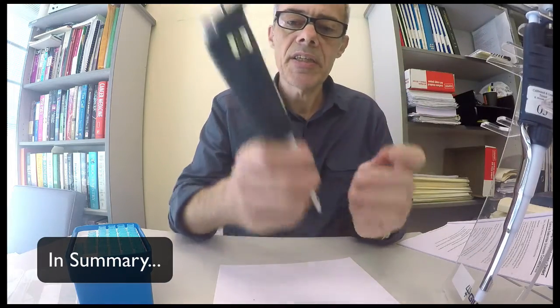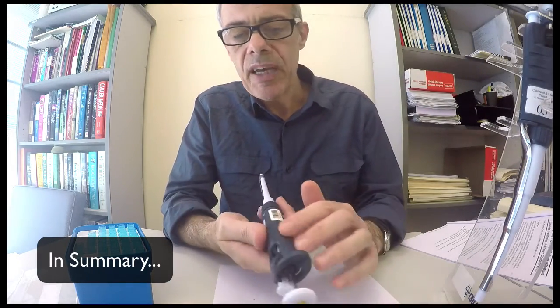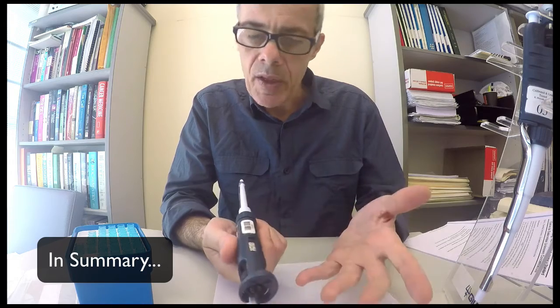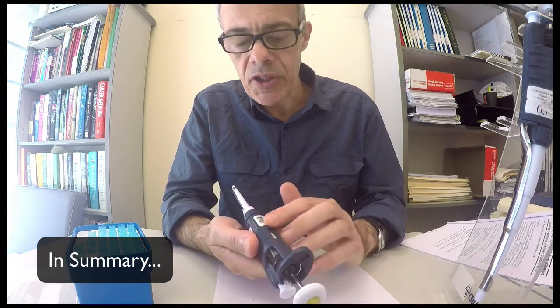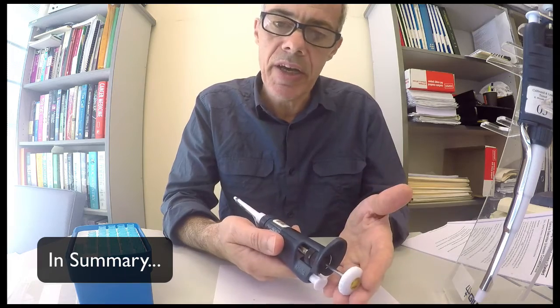For some of them it's easier, like the P200. The maximum unit here is 200, and therefore 200 on the scale is 200 microliters. 180 on the scale is 180 microliters.